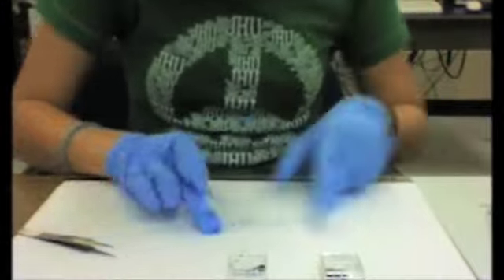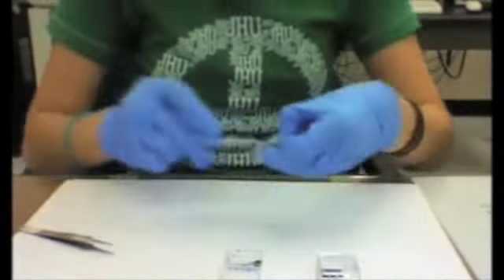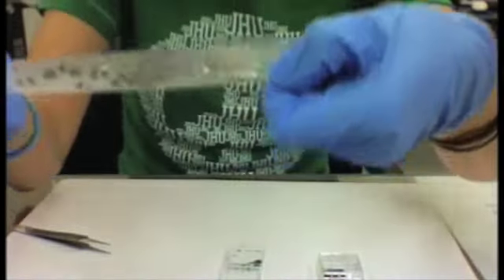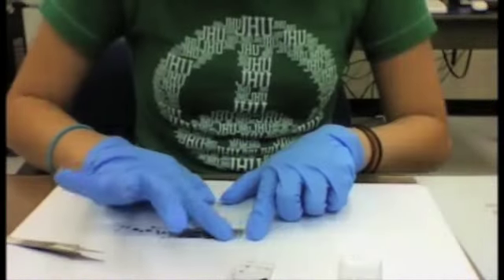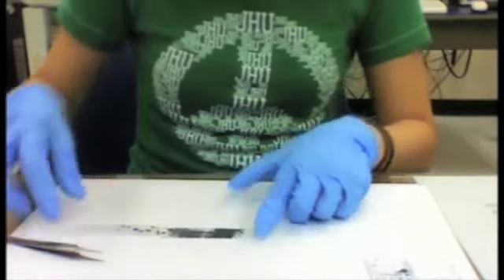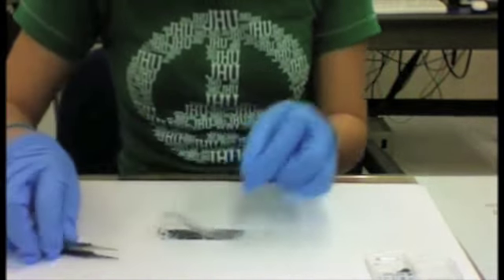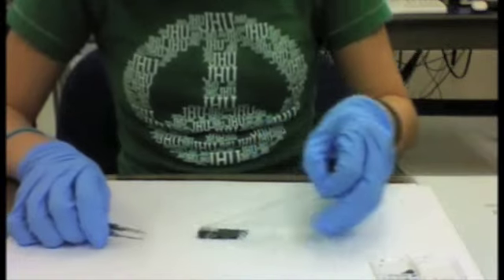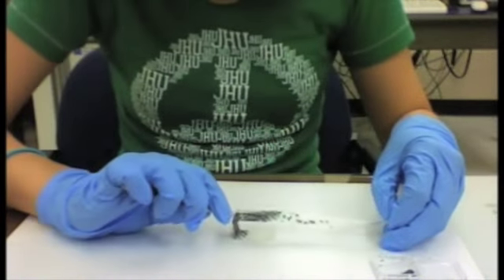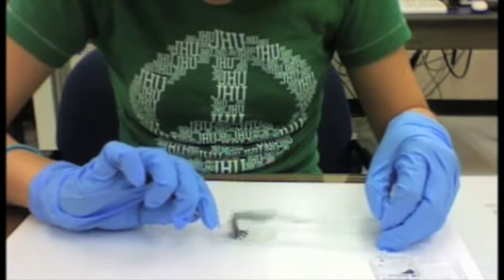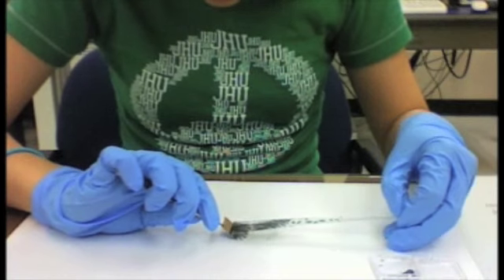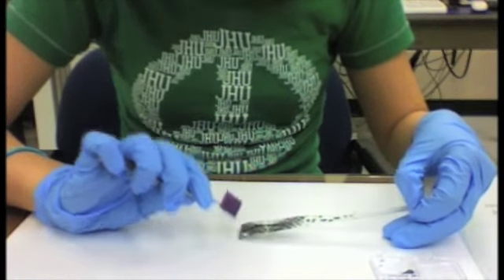Repeat this process. Next, take a silicon wafer and place it on the tape. Rub the graphite onto the wafer and peel the tape off gently. The wafer is now ready to go through an optical technique and confocal Raman spectroscopy.